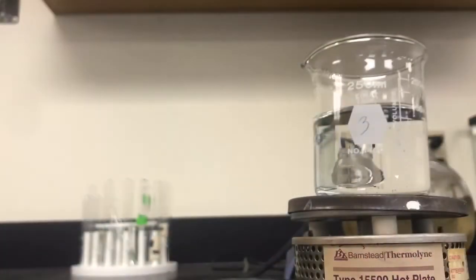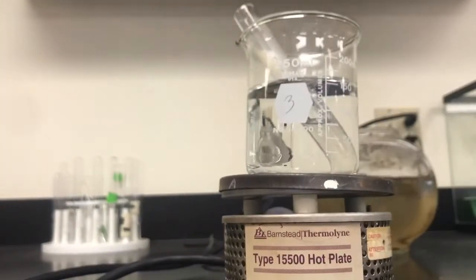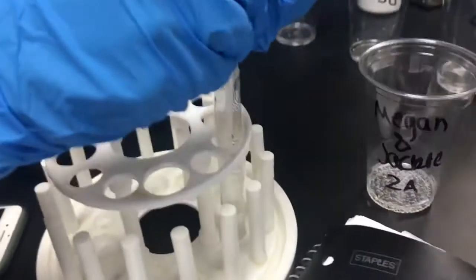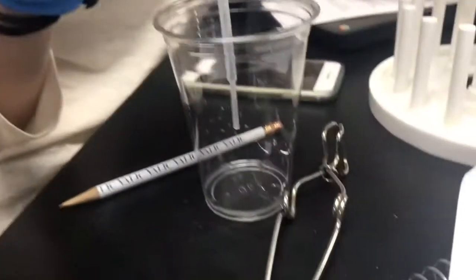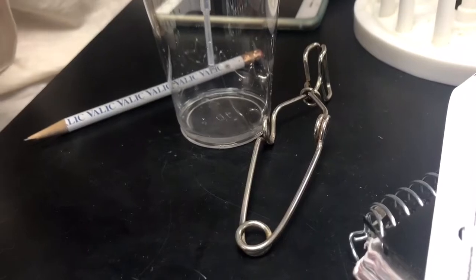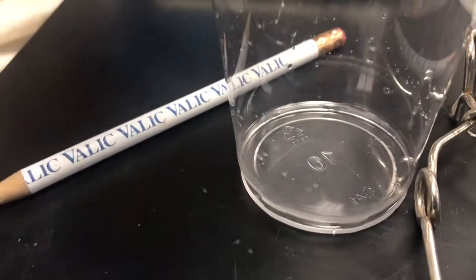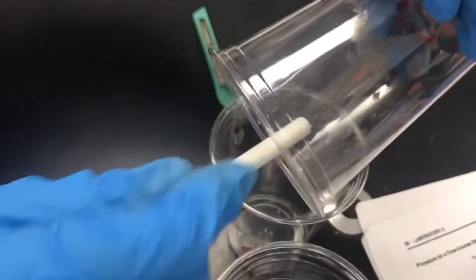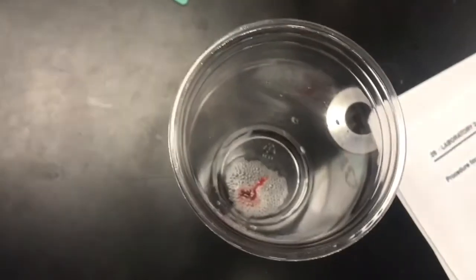We started boiling water next and then put a test tube of 5 milliliters of the catalase into the boiling water for 5 minutes. Then we removed the test tube. We got a plastic cup and filled it with the same concentration of hydrogen peroxide and put 1 milliliter of the cooled catalase into the hydrogen peroxide. Once the catalase was added, it didn't bubble, which means the enzyme denatured.